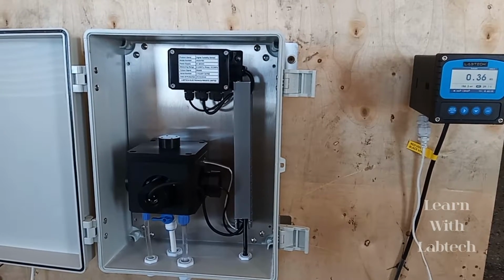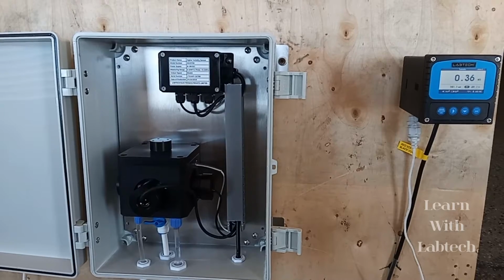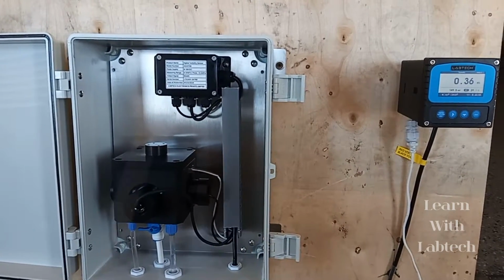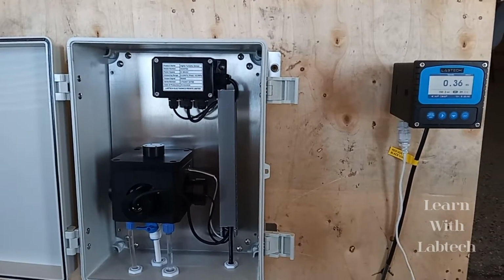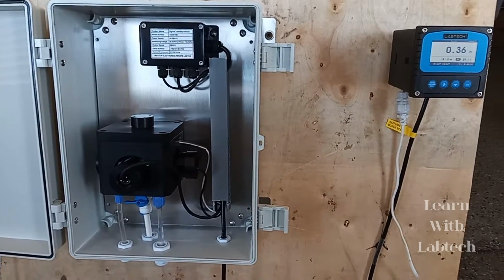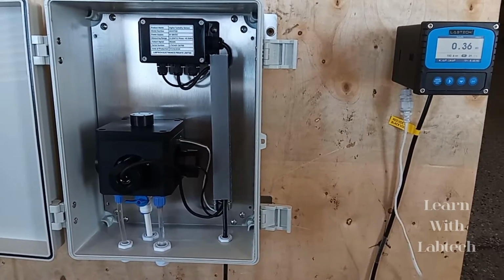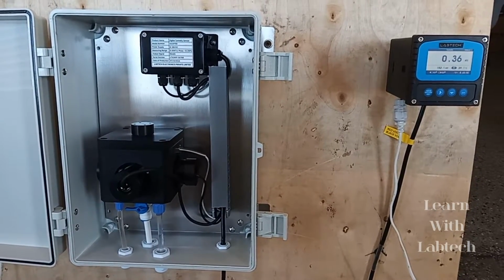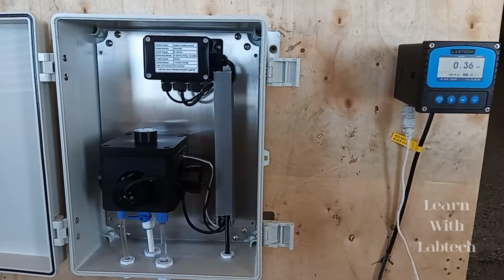So why do we measure turbidity? The primary reason is to gauge its cleanliness. If the water is clean, our health will be in good condition, so we can connect this to health reasons also. If left untreated, if you are not using any turbidity sensor for drinking water, potable water, or any water, that will offer a haven for bacteria to grow in the particular sample solution. So high turbidity can cause waterborne diseases also. So turbidity measurement is very important.